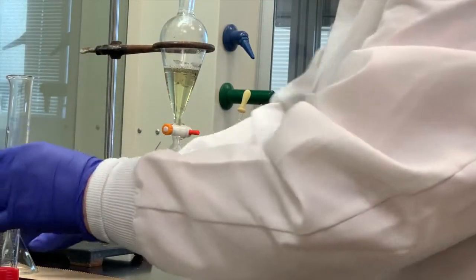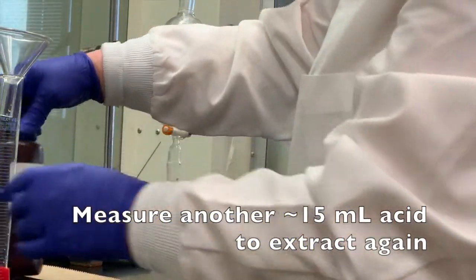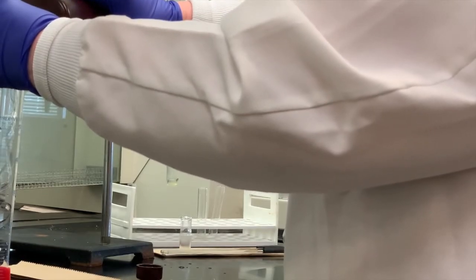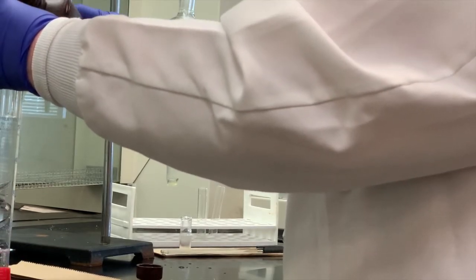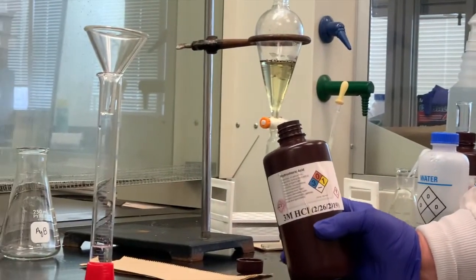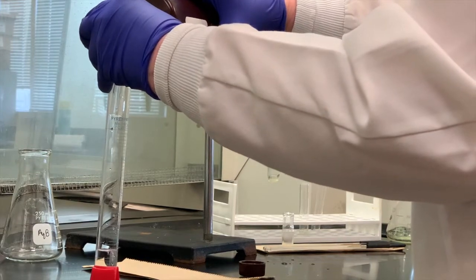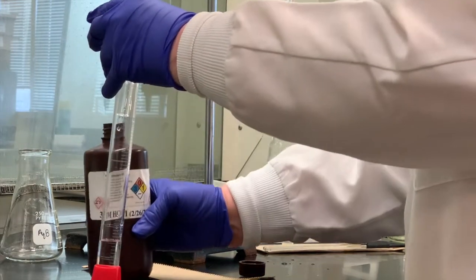And then I'm going to measure out another 15 mils of the hydrochloric acid, again 3 molar. And if you go a little more, a little less, it's not critical that it has to be exactly 15. Since we are washing it 3 times.